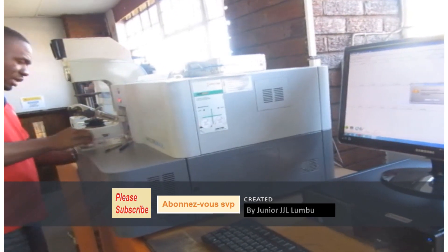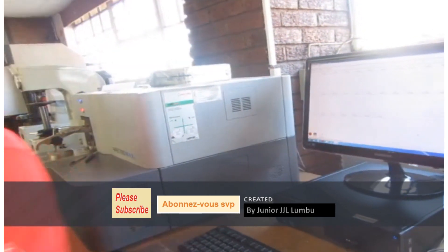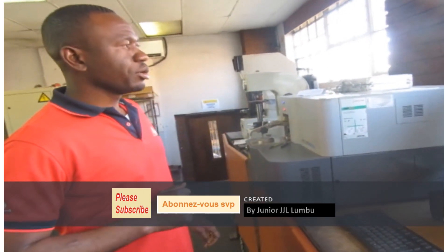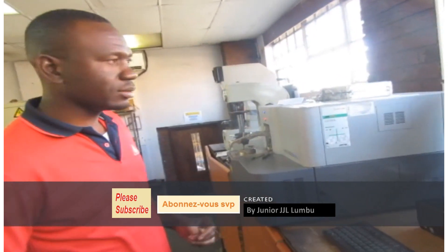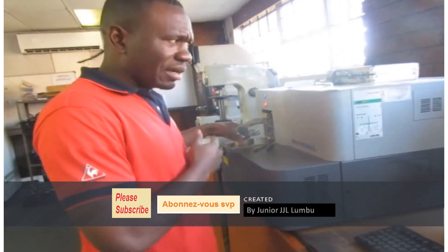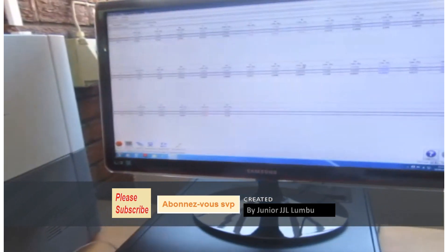I'm going to take a clear sample here and go with that one. It determines the elements that the sample contains — whether carbon, silicon, manganese, phosphorus, magnesium, nickel, aluminium, copper, everything. After sparking, I'm going to show you how the spark looks like.